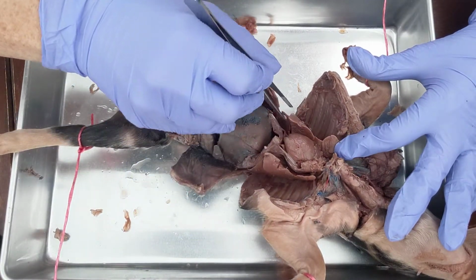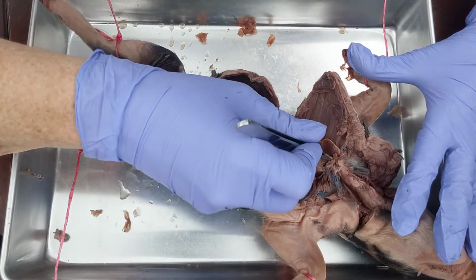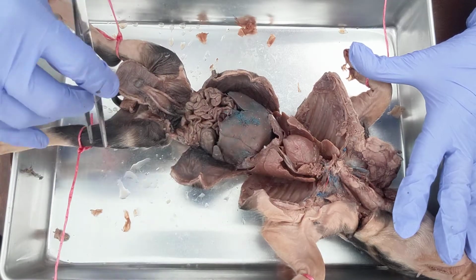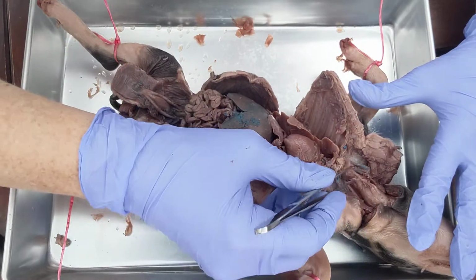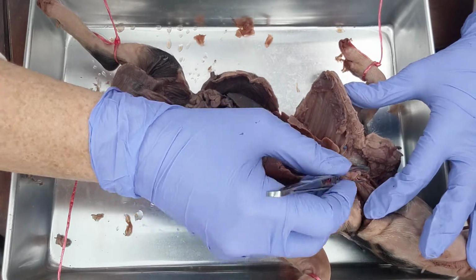Okay, and then surrounding the heart, those are the lungs. See all the lungs there, and you have the major blood vessels coming out of it. I haven't really dissected for them, but the blue ones will be the veins, and the red ones will be the arteries. And then continuing up, you see all of this. This is muscle, and there's also possibly the thymus in there.